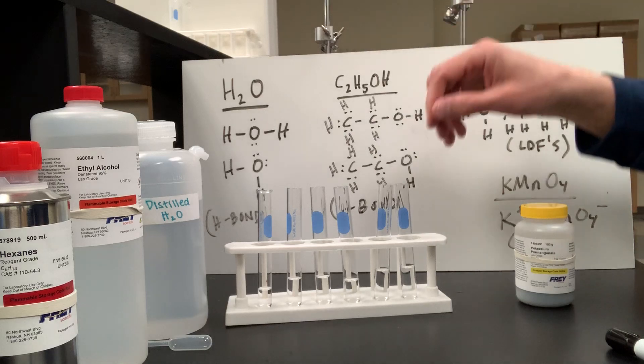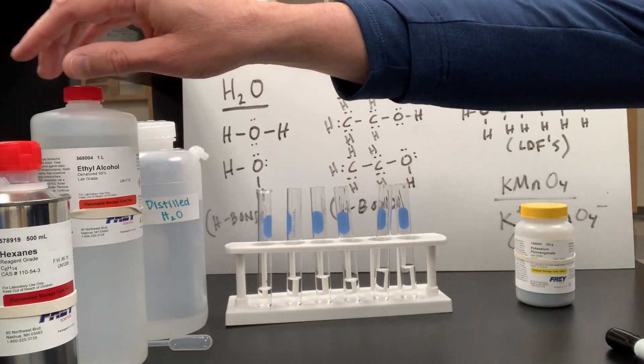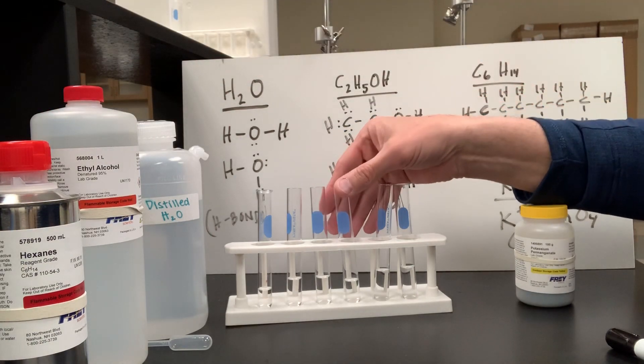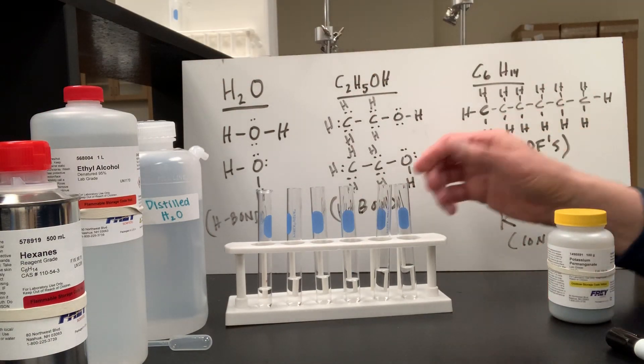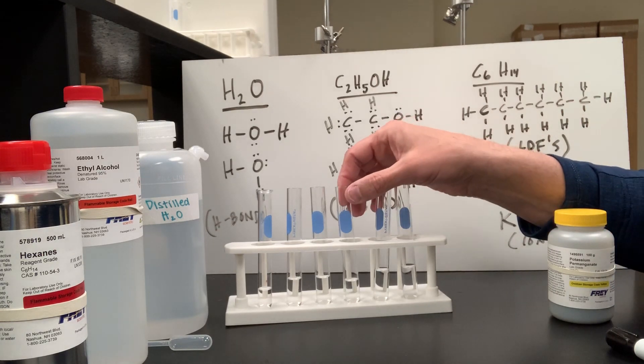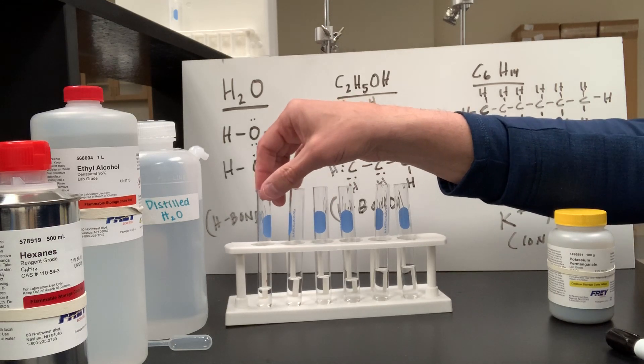So I have today some distilled water, I have some ethanol or ethyl alcohol, and I have some hexane. I have some test tubes set up with those three liquids in them. This first test tube is water, and then I have some ethanol and hexane, and then it just repeats itself: water, ethanol, and hexane.